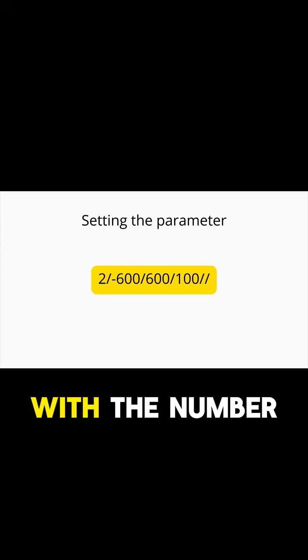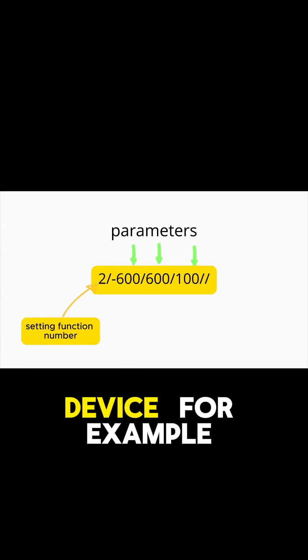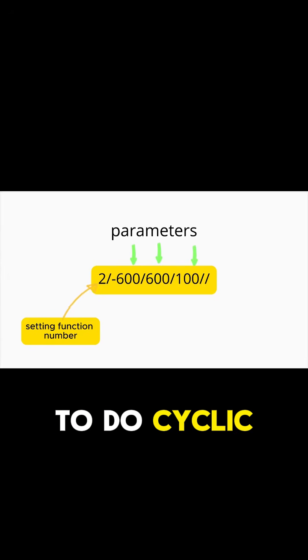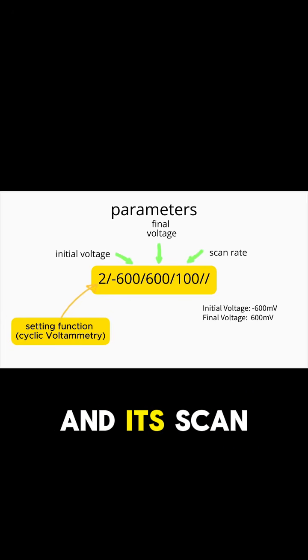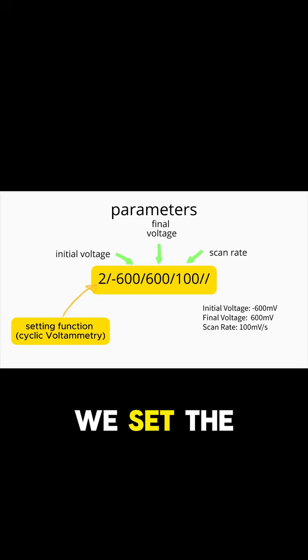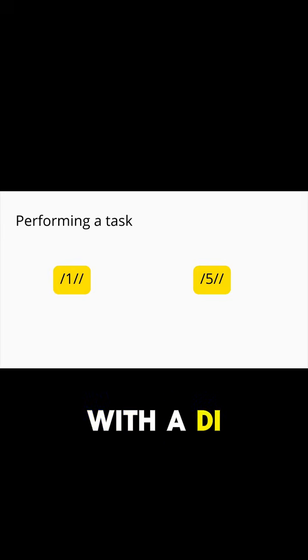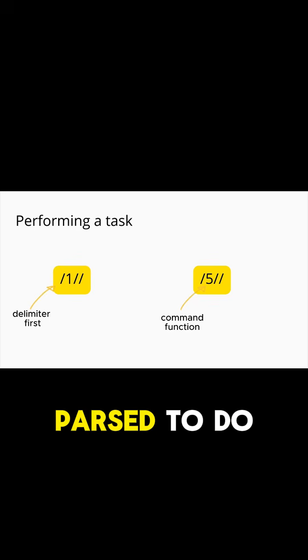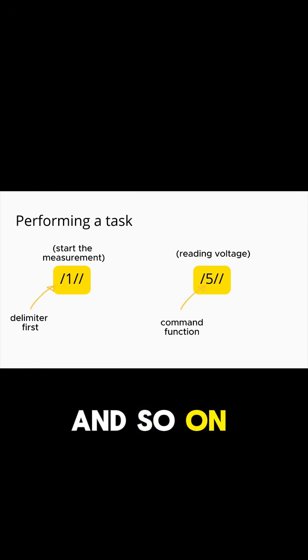When the buffer starts with a number, the buffer would be parsed to set the parameter to the device. For example, when we want to do cyclic voltammetry, we want to set the initial, final voltage, and its scan rate. This is where we set the parameters. On the other hand, when the buffer starts with a delimiter and a number, it would be parsed to do certain tasks, such as start the measurement, check the voltage, and so on.